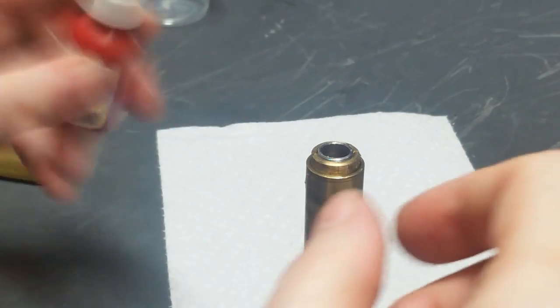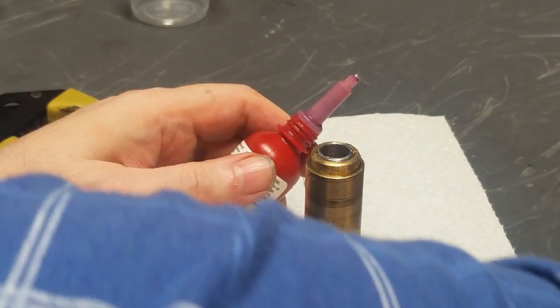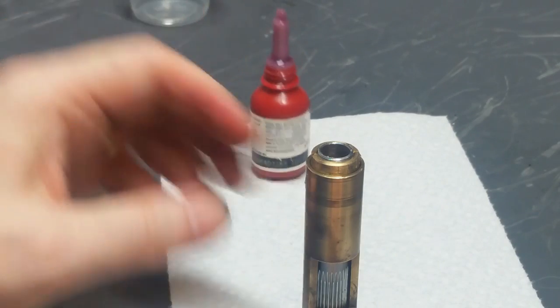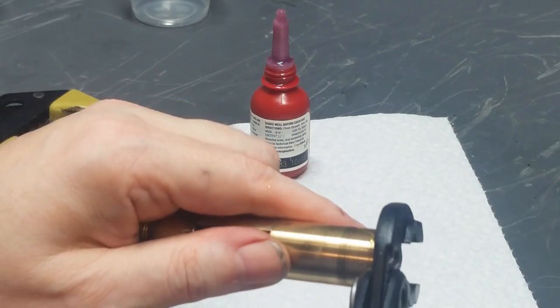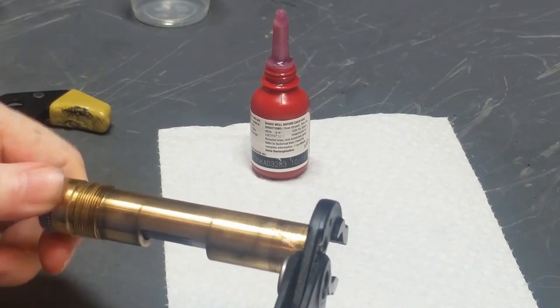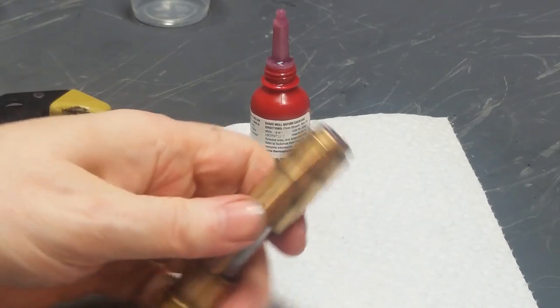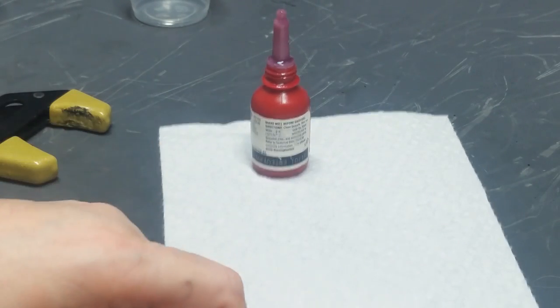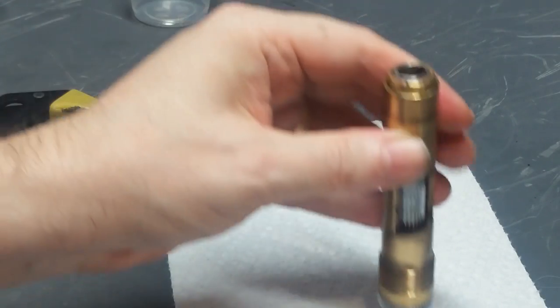This is purple Loctite. Of all the various Loctite formulations, it's the one that holds with the least force. Blue holds a little harder, and red is considered permanent, can only be removed with a torch, so you don't want to use red and you really don't want to use blue. But what I'm going to do is put a little bit of it in there, then I'm going to back this off, then tighten it back down so that some of that Loctite actually gets in the threads. And make sure I find my magic point here, make sure it feels really good at that magic point. And then that Loctite will set up and this will never move during operation, so it should be good for the life of the unit.